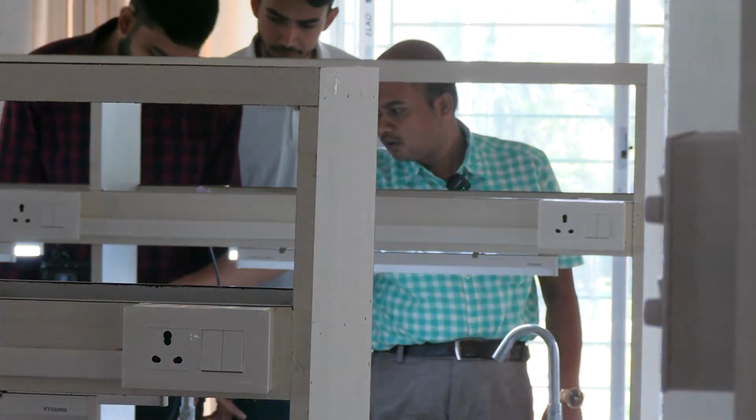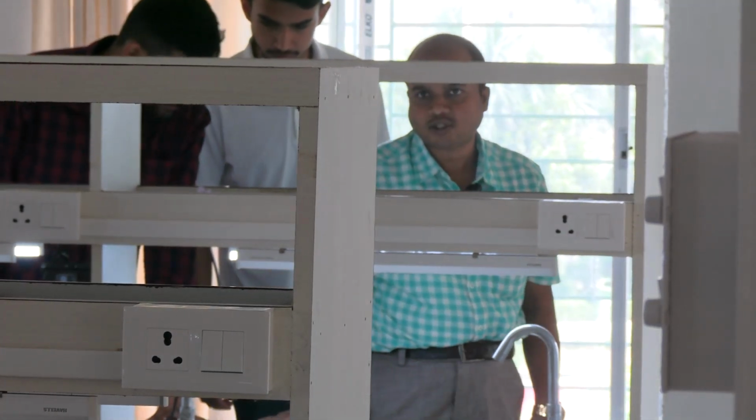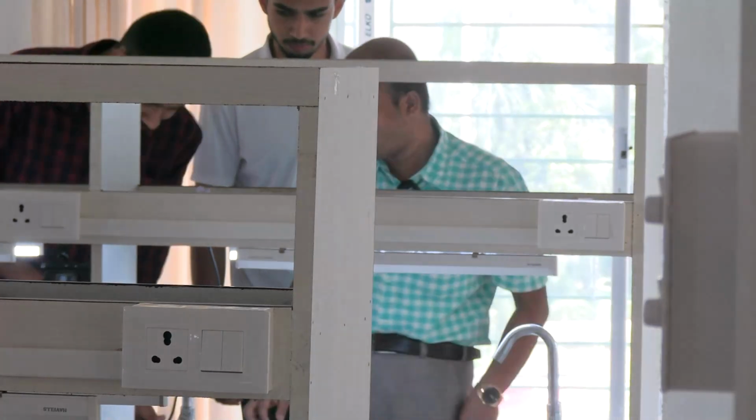But sometimes they do not work properly. So you have to focus again if you change the lens. Don't see under 5x. It is not needed.